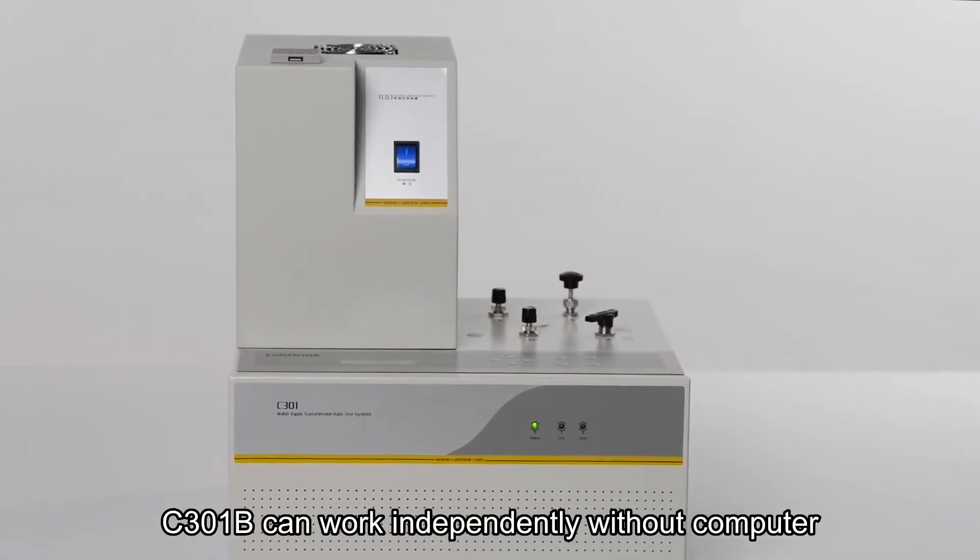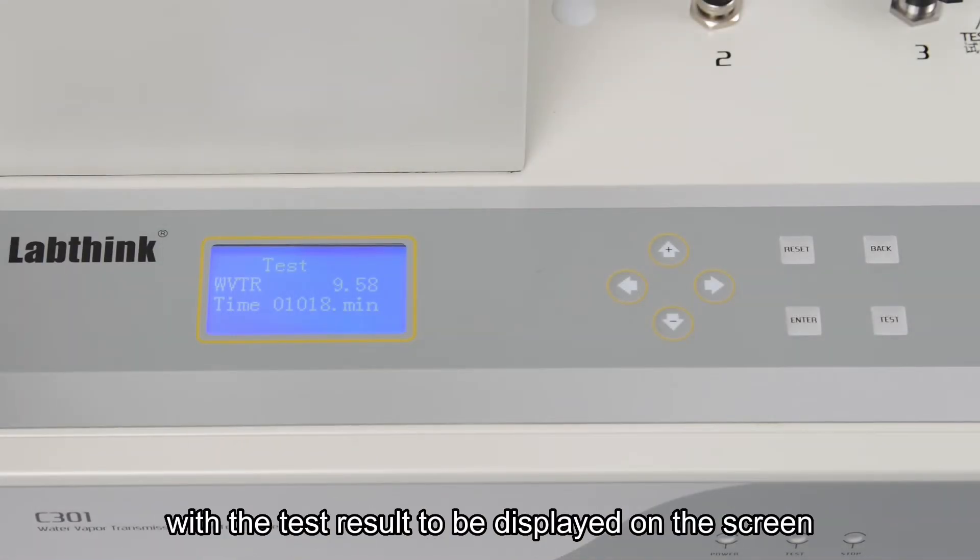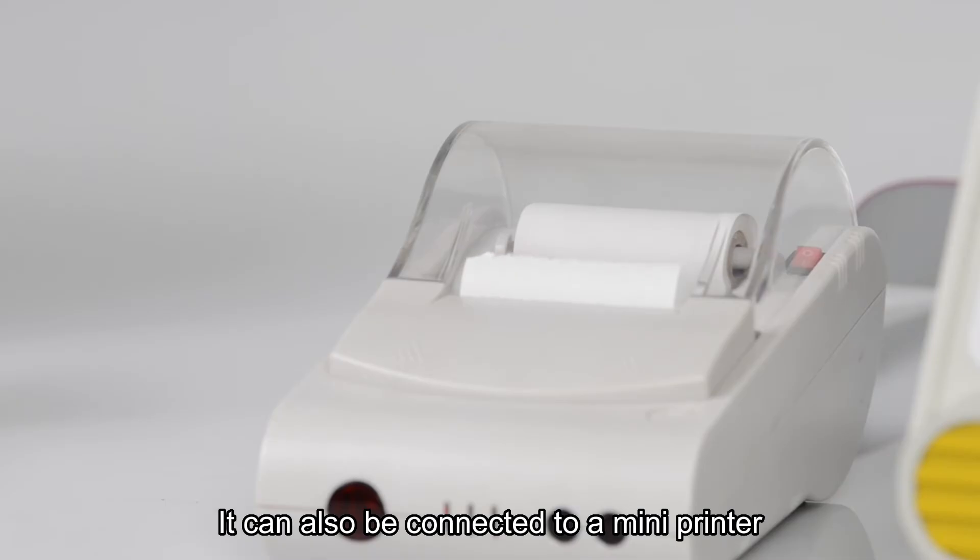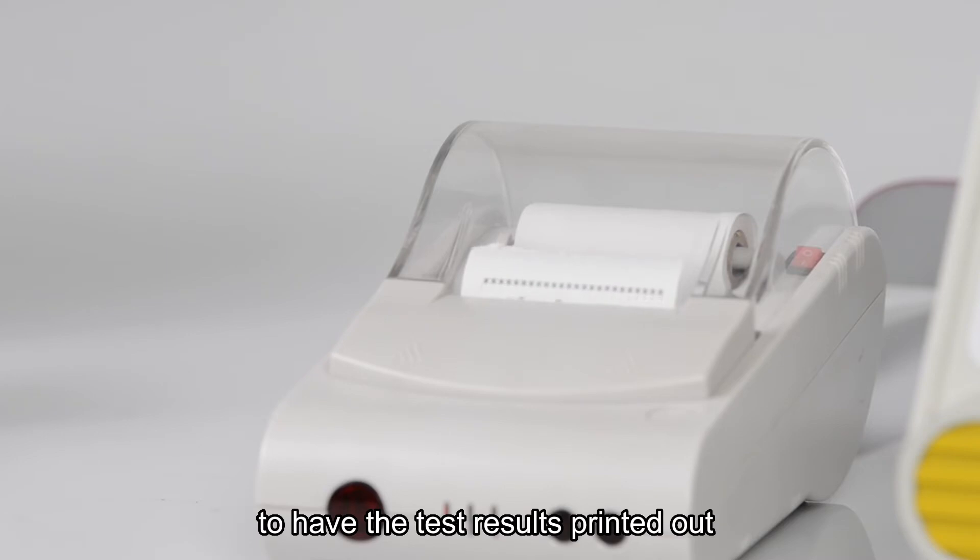C301B can work independently without a computer, with the test result to be displayed on the screen. It can also be connected to a mini printer to have the test results printed out.